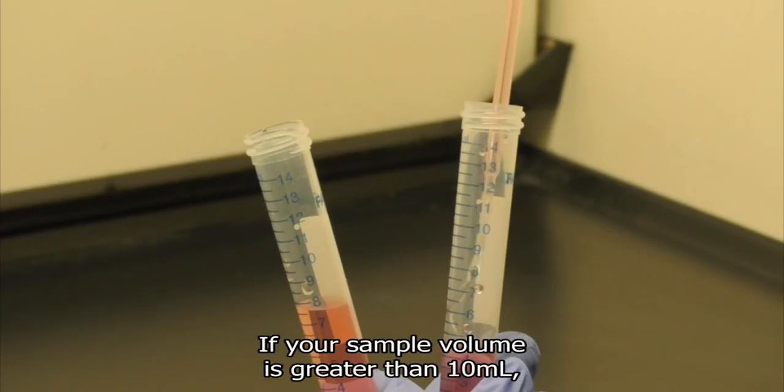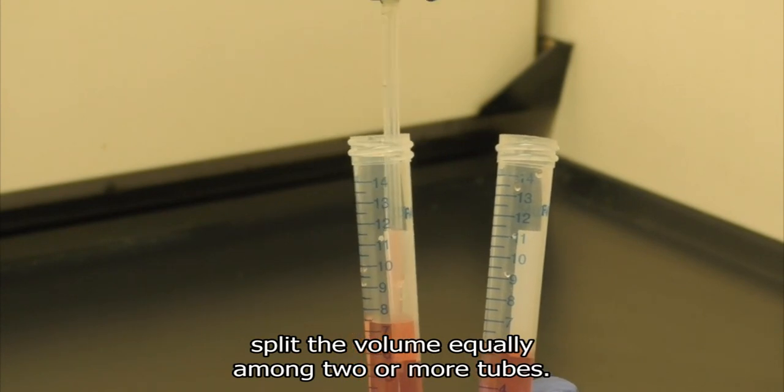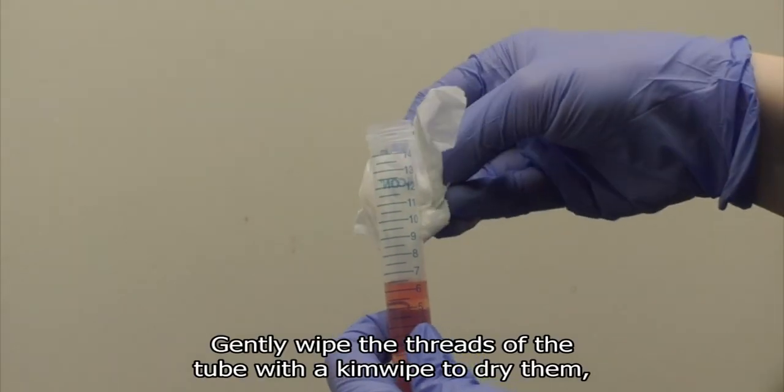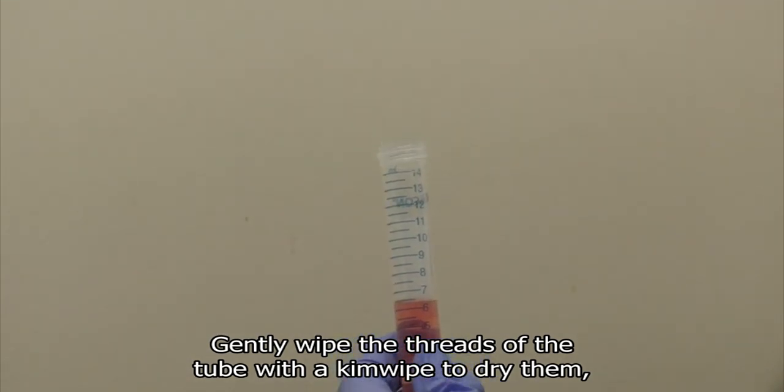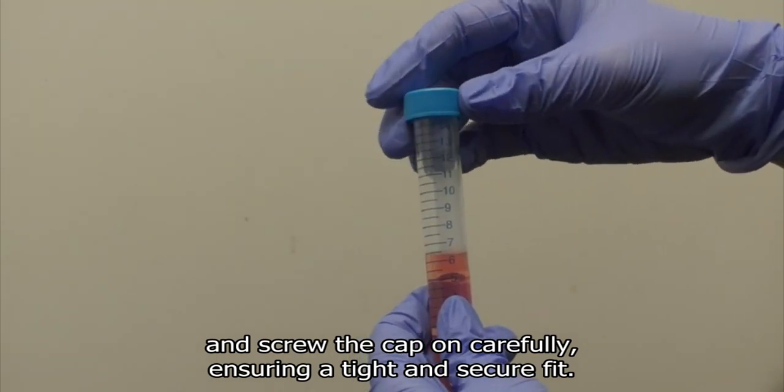If your sample volume is greater than 10 milliliters, split the volume equally among two or more tubes. Gently wipe the threads of the tube with a kimwipe to dry them and screw the cap on carefully, ensuring a tight and secure fit.